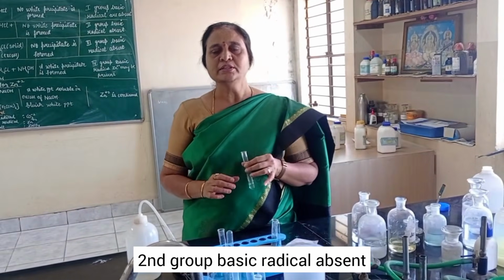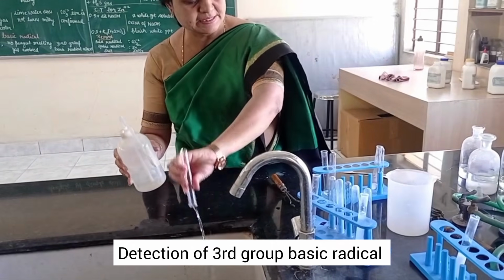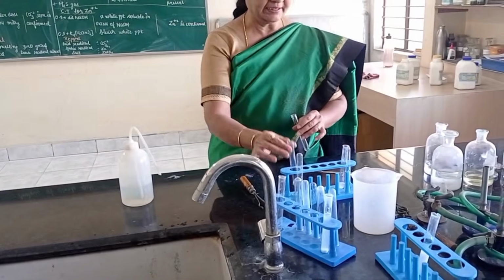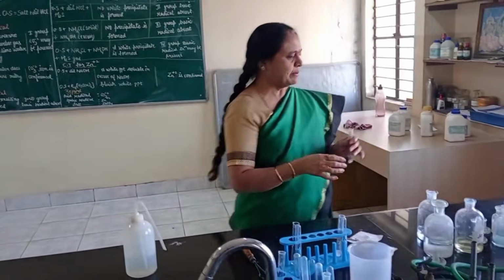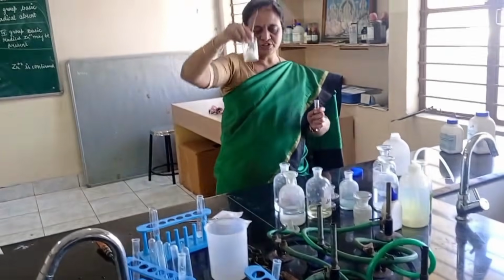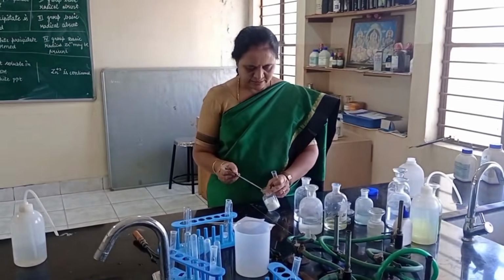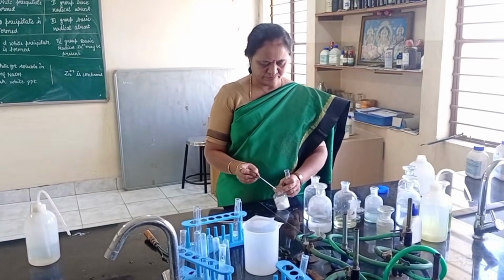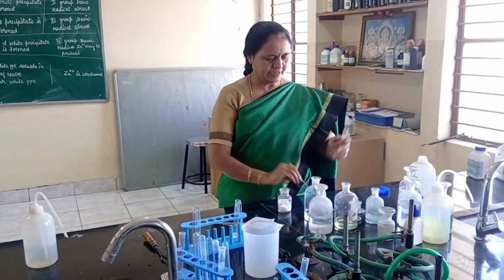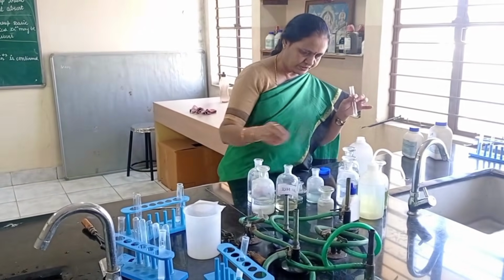Then I move to third group basic radical. Detection of third group basic radical. For this, I take original solution, OS. I am adding solid NH4Cl. Then I add NH4OH solution.